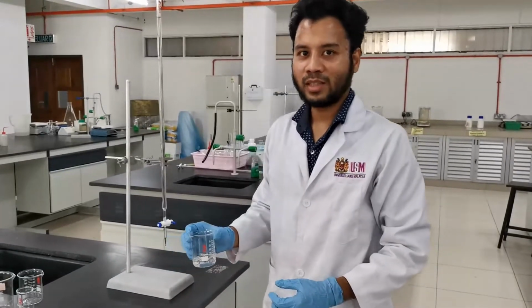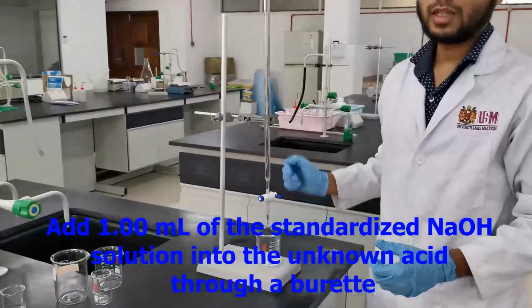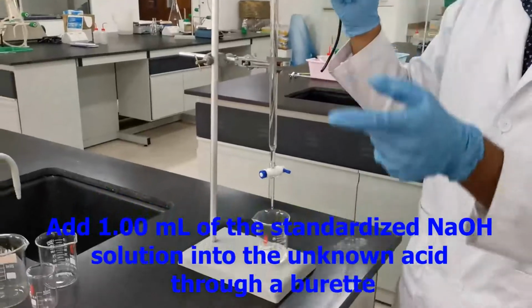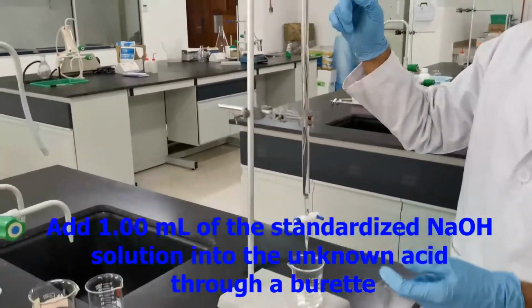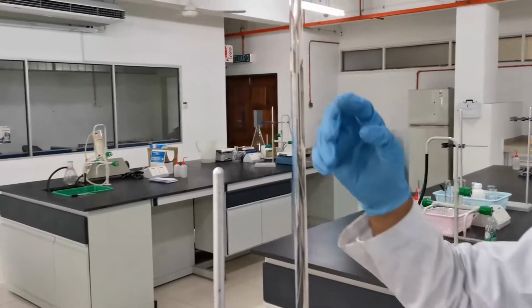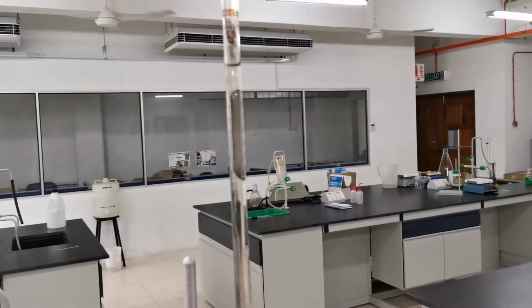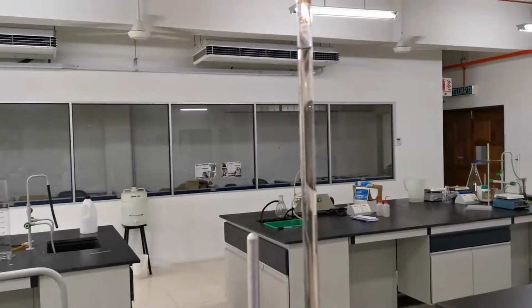The next step is you need to add exactly 1 ml of sodium hydroxide, which you standardized in the previous step. You need to add it using a burette because that is accurate up to 2 decimals. Add exactly 1 ml of sodium hydroxide into the unknown polyprotic acid.